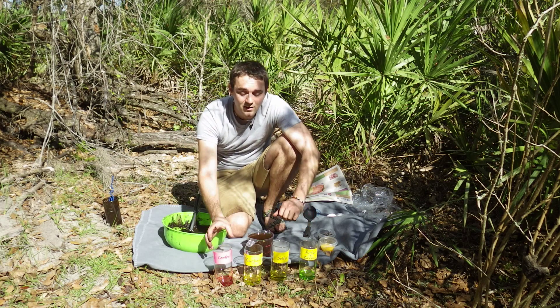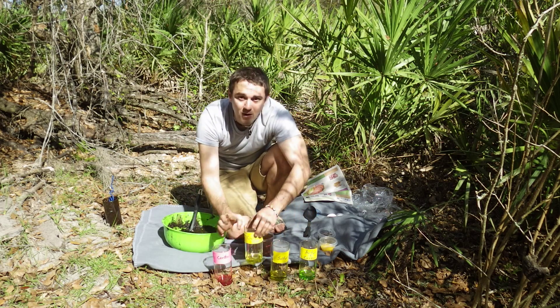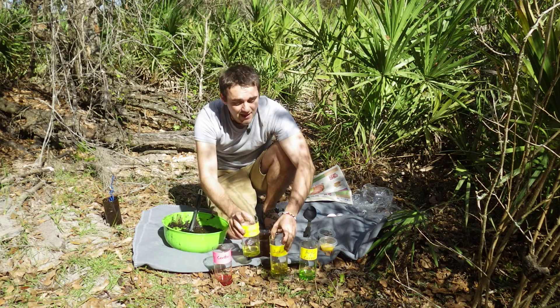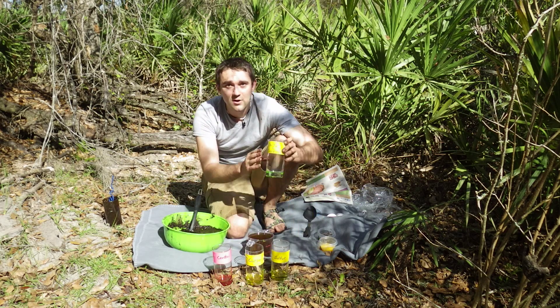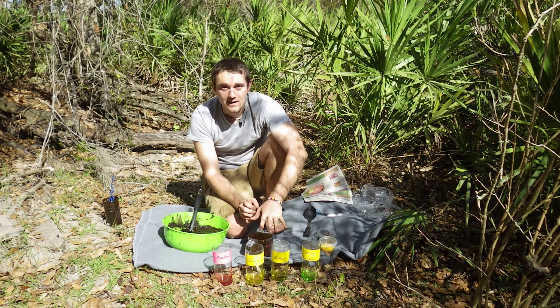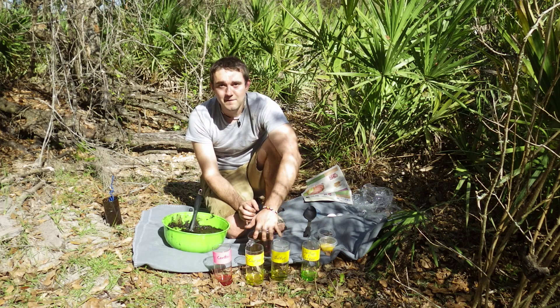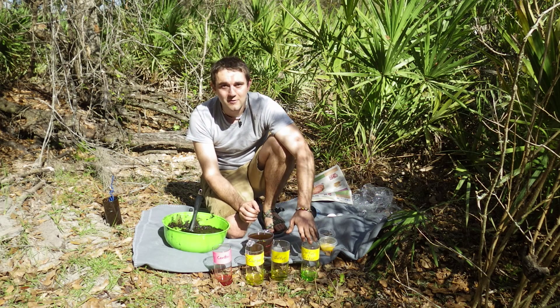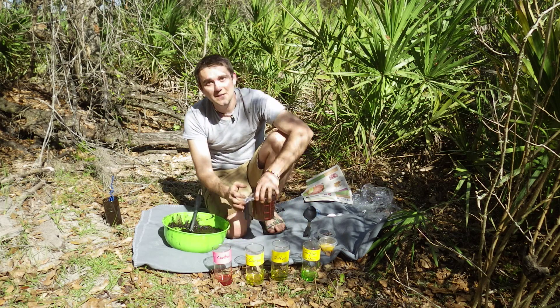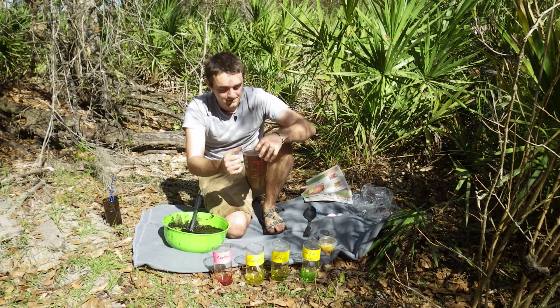We're going to set up four columns: a control, one with only carbon, one with only sulfur, and a last column that has both the sulfur and the carbon. Each will have the mud, and the carbon and sulfur columns will have their specific ingredients, with the combined ingredients in the final column. On top of all of these we'll put our source water, which also contains the microbes.